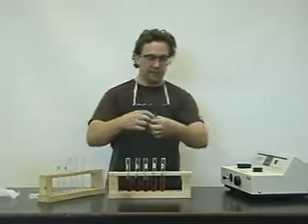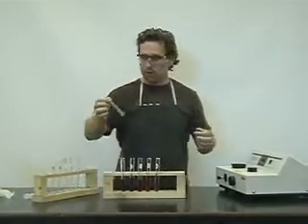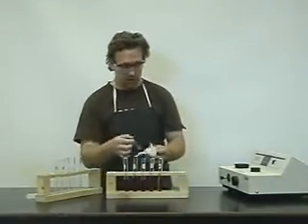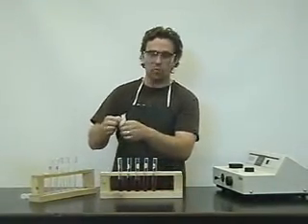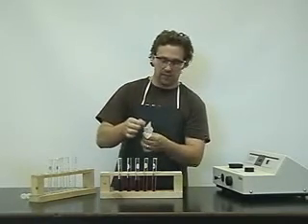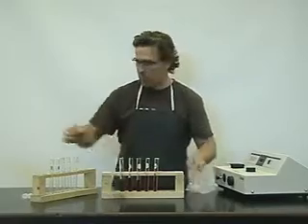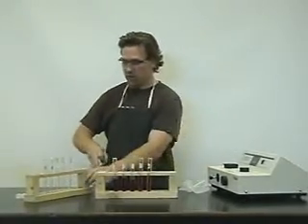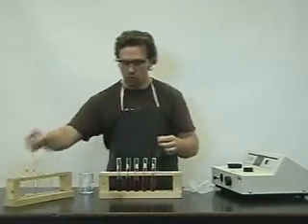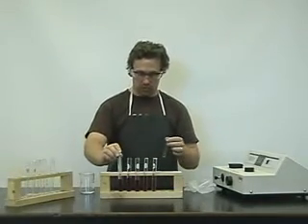What we've done is we've already standardized the machine to take an absorbance for this cuvette. It's important to note that we must always wipe. We don't want any fingerprints on it, nor do we want any solutions. Now, it's really important also to rinse the cuvette with each solution.